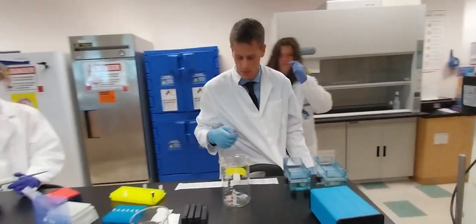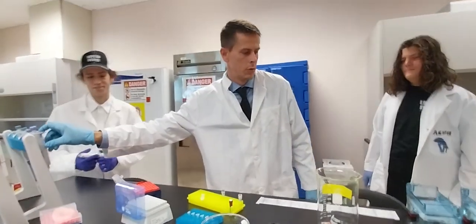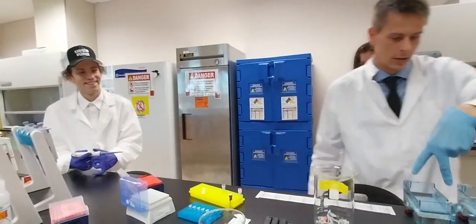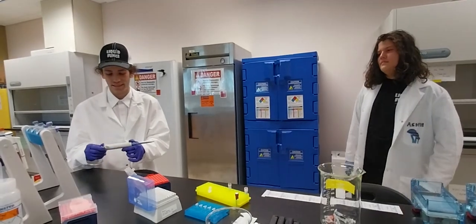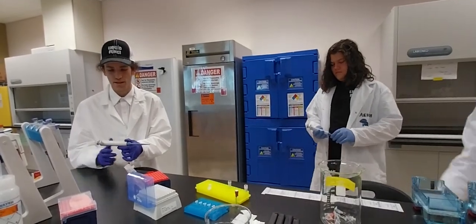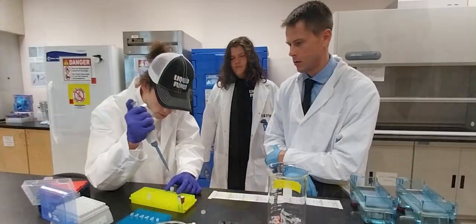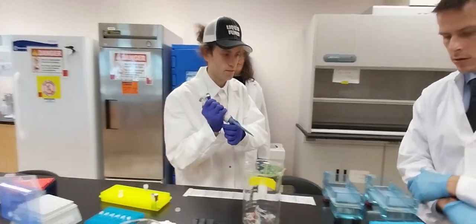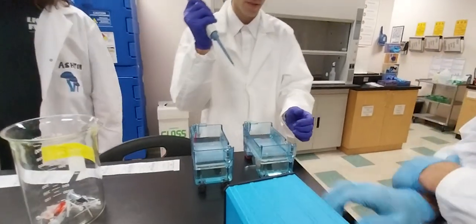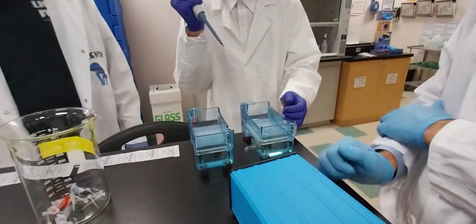All right, now you guys. Okay, we need one, one on this end and then these two. All right, so I'm going to start. I just want you to put this into the well. Go all the way at the end on this one. Okay.